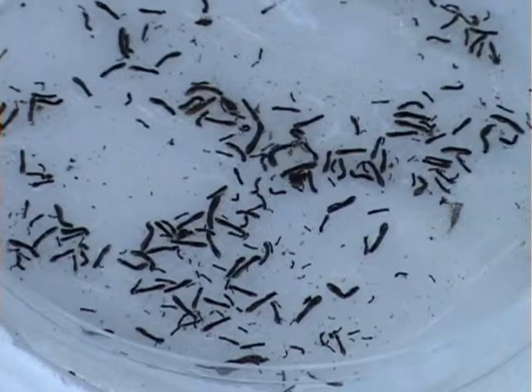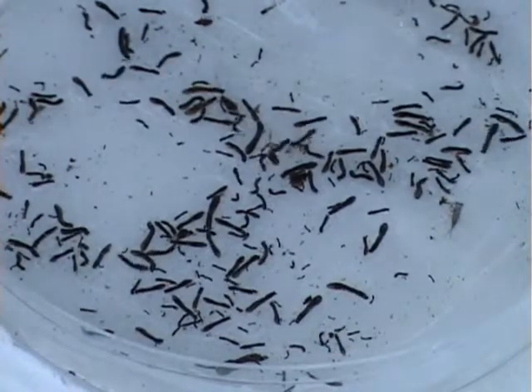There's a second bag from this collection, and I want to show you another kind of suitable host. This larger dipteran here — here's a small midge which we had collected earlier, and a second small midge — but you can see the incredible size difference. Both of these are suitable hosts for gut fungi. And again, we have some mayflies, various sorts, but all of these will be good potential hosts for gut fungi. So we've finished with this preliminary sorting of our collection materials.